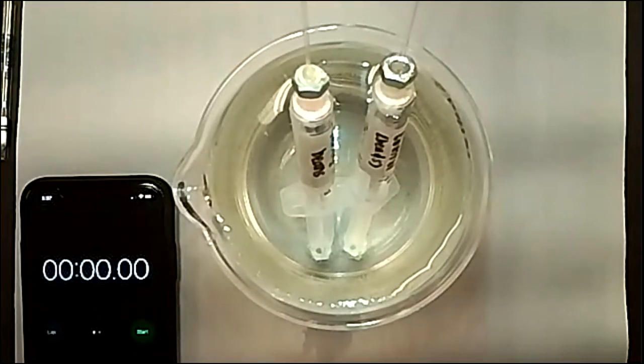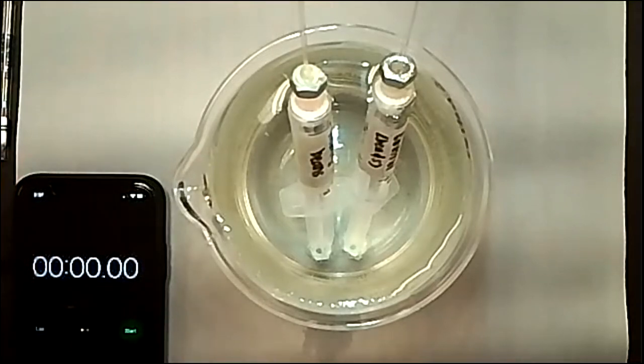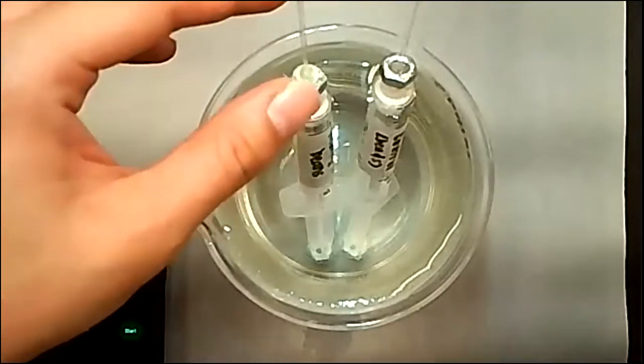So I'm going to add in the initial manometer fluid, and every 2 minutes we're going to mark down the change in where the manometer fluid is. And then at the very end, I will measure out the distances for you in centimeters, and then you will do the calculations in the table by yourself. So let me go ahead and add the manometer fluid.